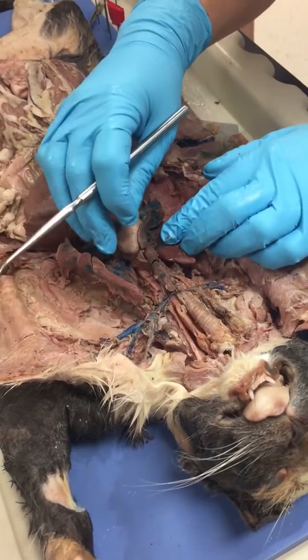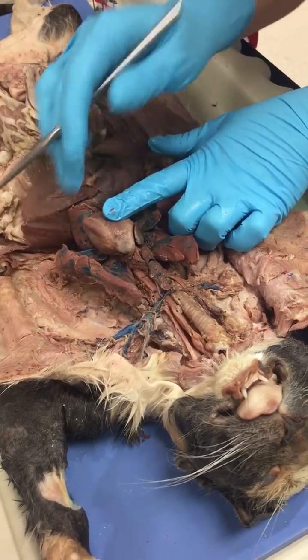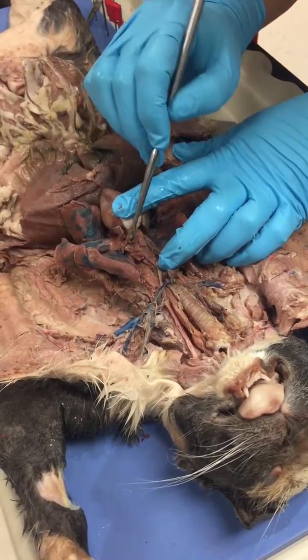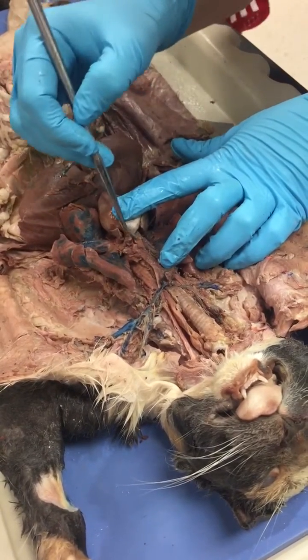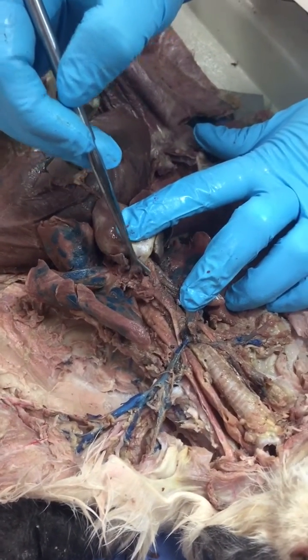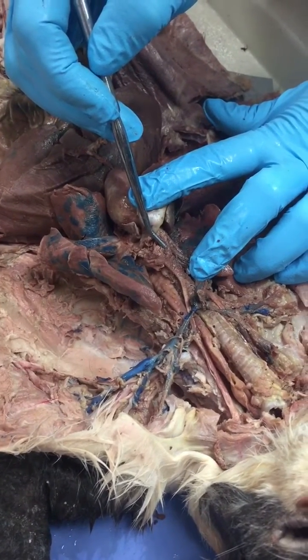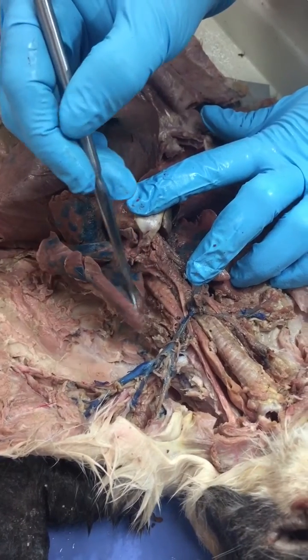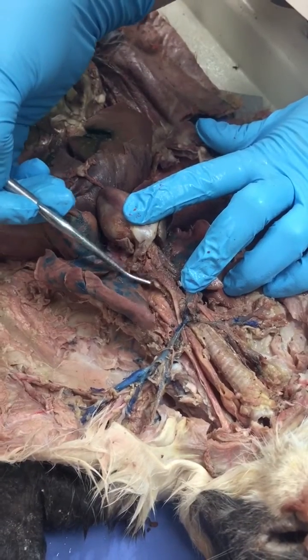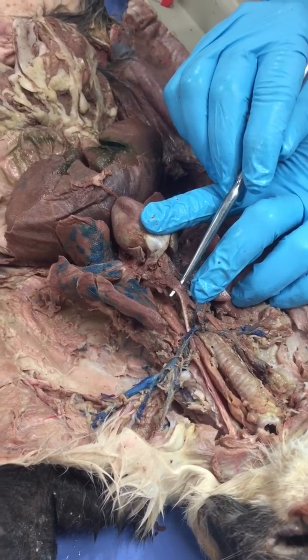Alright. Then when you look at the heart, this is the atrium of the heart. Right there then is the arch of aorta. Do you see this arch? Right there is the arch of aorta. Coming out of the arch of aorta, you have three main arteries. The left subclavian has been cut. So that has been cut. This is the brachiocephalic trunk.